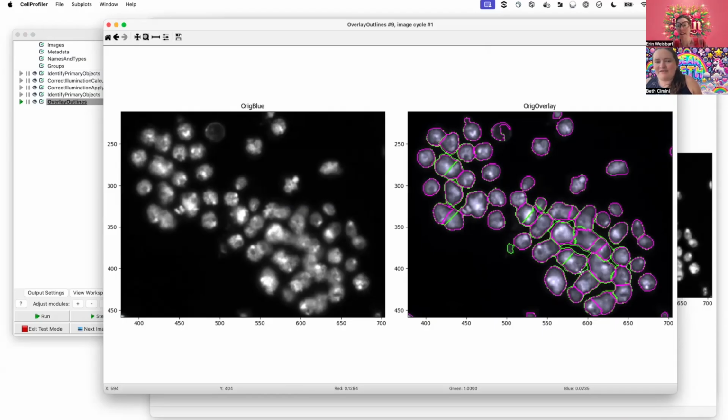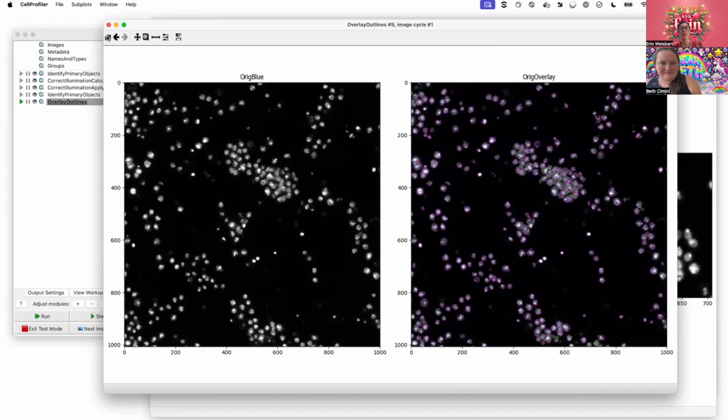I think we've said a few times now in the podcast that perfect is never the goal, just good enough. But I think I like the segmentation I'm getting with this illumination correction applied. And as we keep saying, anything you do to an image is fair game for object segmentation.